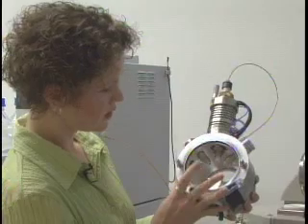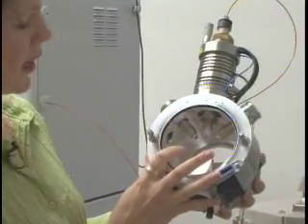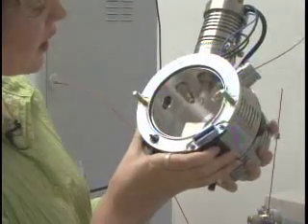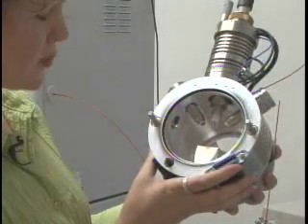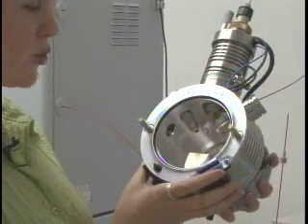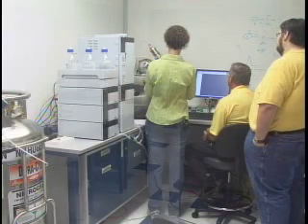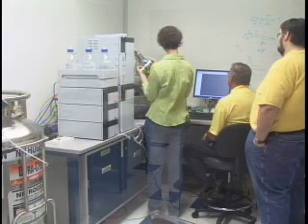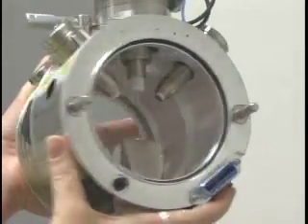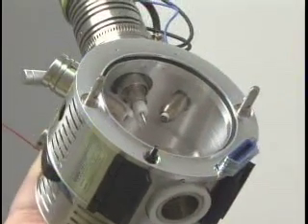The probe in the center is where the sample actually comes out. There's an electrode — a very small piece of wire — inside that probe which houses the actual sample. The two stems on either side of the probe are commonly referred to as 'hair dryers'; they're a heated gas source which causes solvent evaporation, enhancing the ions making it into the mass spec side. This is where the samples go to waste. The sample is introduced perpendicular to the instrument plate.